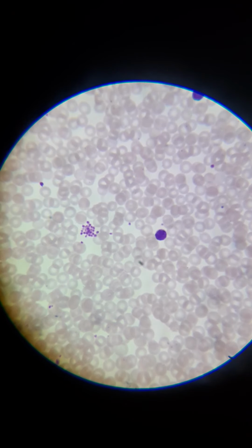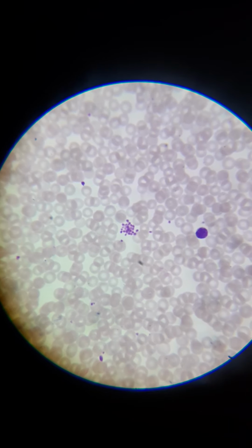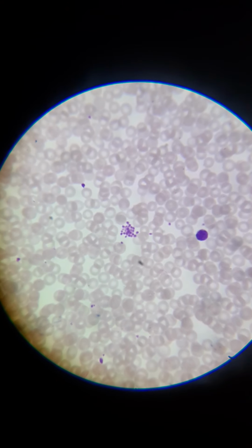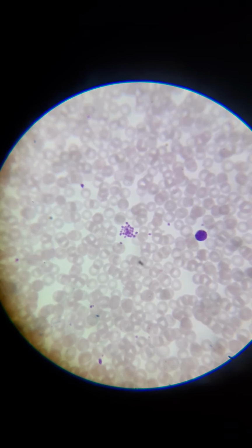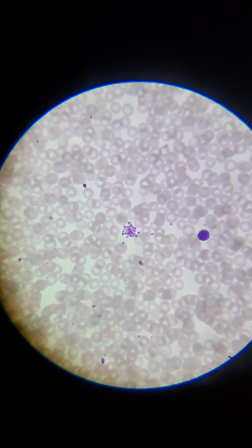And then you'll see a lot of the tiny purple dots, especially that big cluster right there in the middle. Those are platelets, which assist in the coagulation process. So if you get a cut, that's what helps stop it. They actually come from a specific cell called a megakaryocyte in the bone marrow, which, if I get to it, I might show and we can look at that. But essentially, that big cell breaks up, and that's where your platelets are derived from.